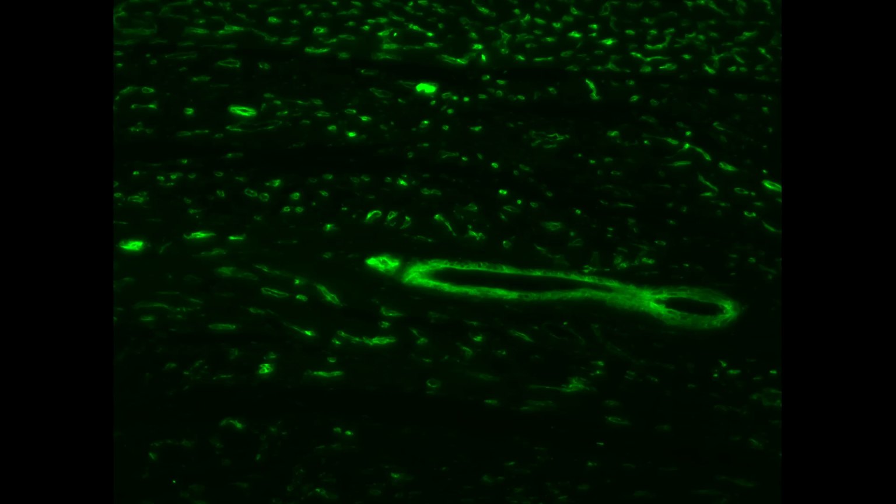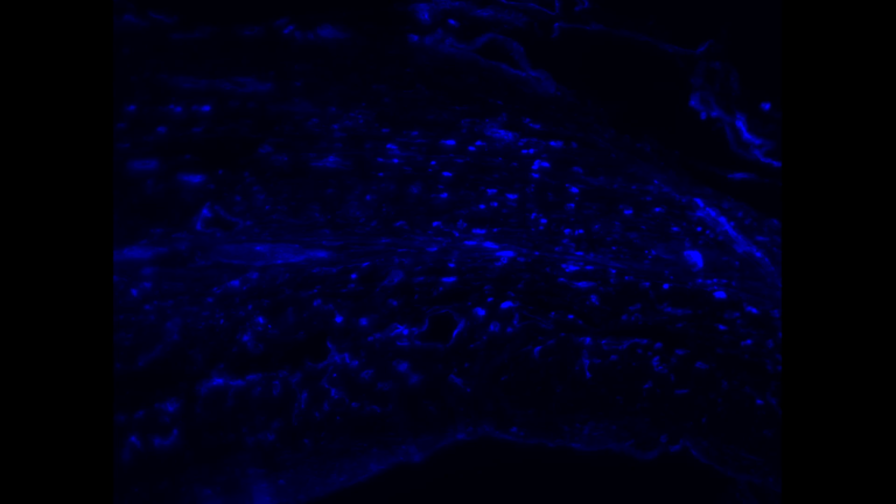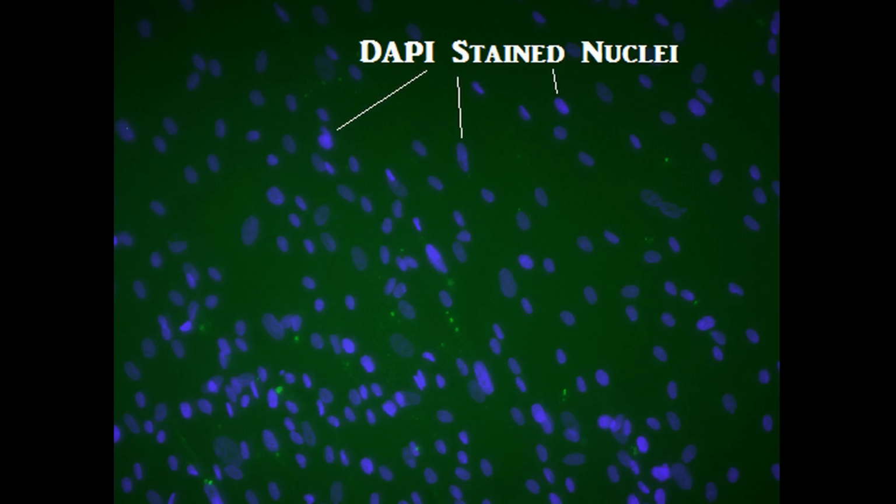By staining samples with fluorophores designed to detect certain aspects of a cell, we can identify whether those targeted areas are truly present. For example, if I stain a sample with DAPI fluorophores, I can tell if nuclei are present because their image will appear via the DAPI stain.